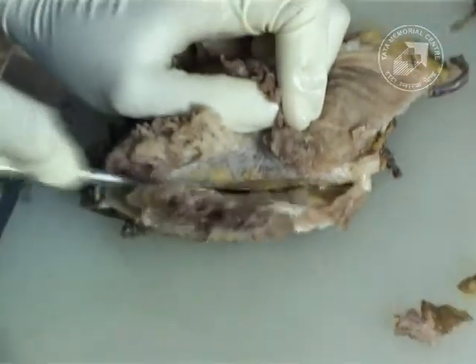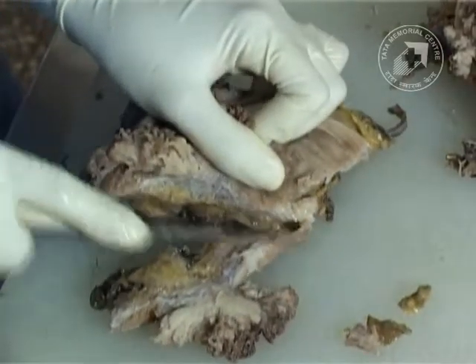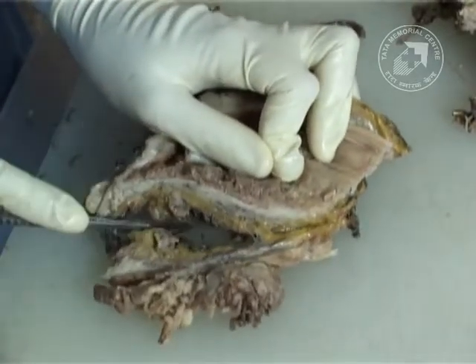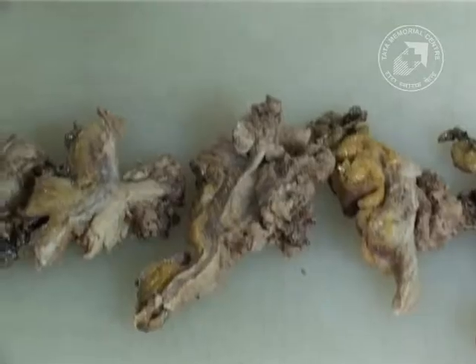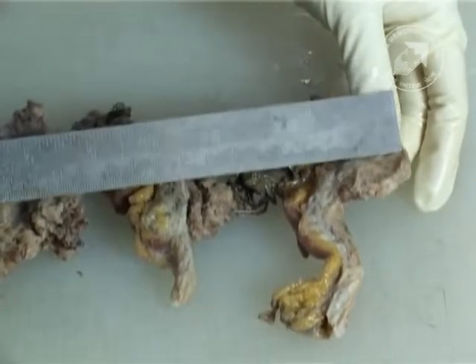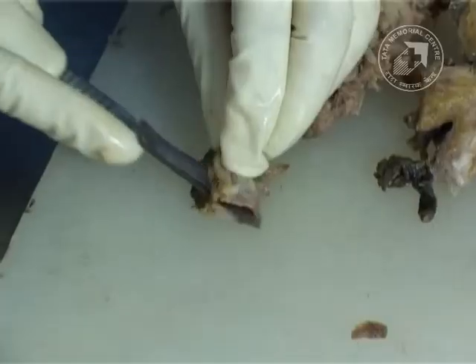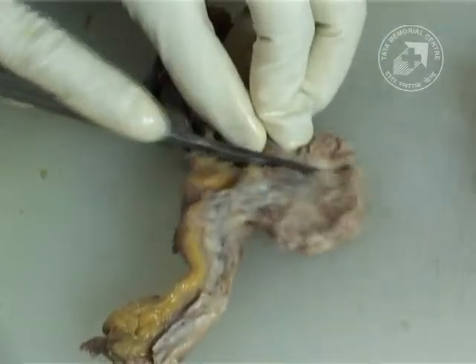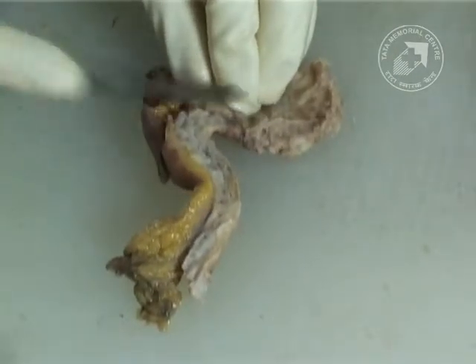Then we start taking sections of the tumor — complete tumor sections along with the muscle coat and the perivesical fat, together with the inked black margins of the specimen. We continue this so that the whole tumor sections are taken along with the wall and we lay them out on the board. We measure the tumor thickness and the involvement of the muscle and try to look at the maximum thickness and involvement of the muscle coat. You can see this papillary tumor being taken with a complete transmural section including the perivesical fat and the peritoneum which is inked.